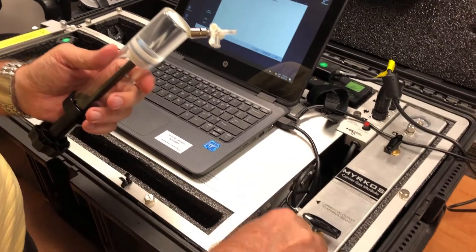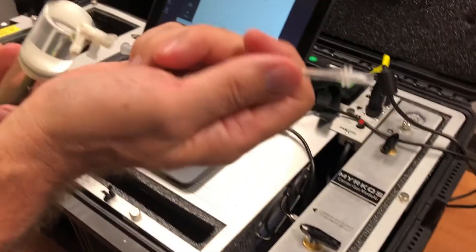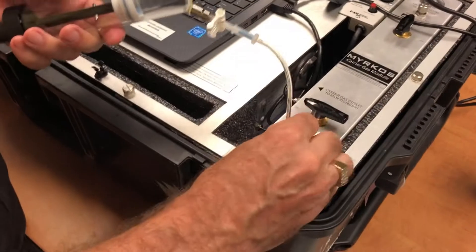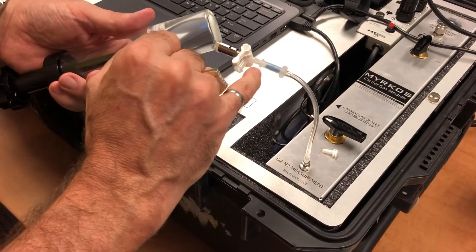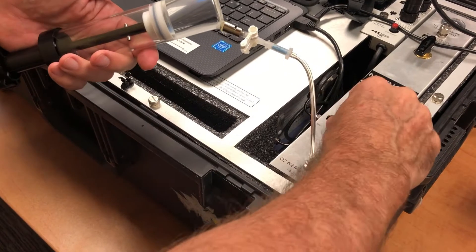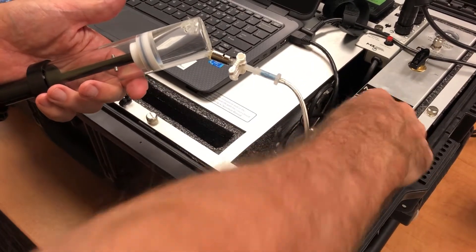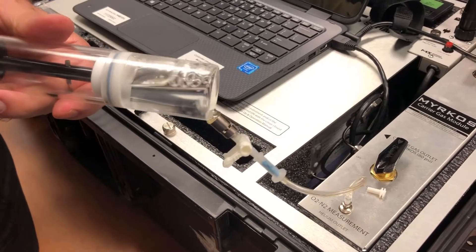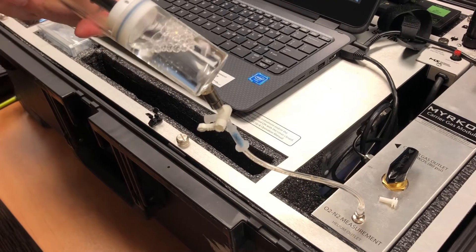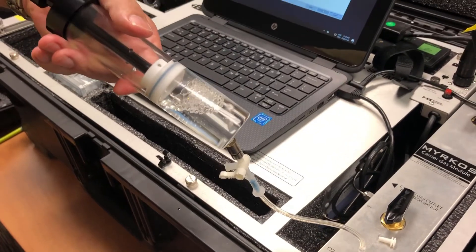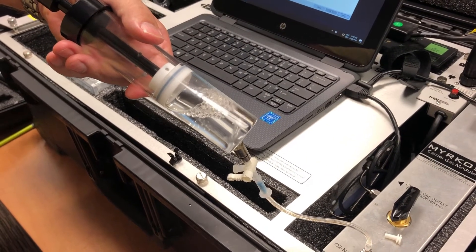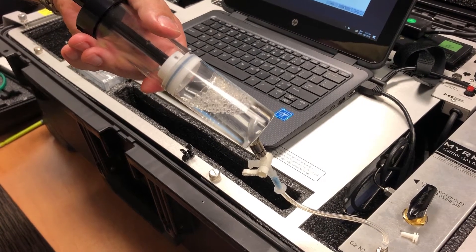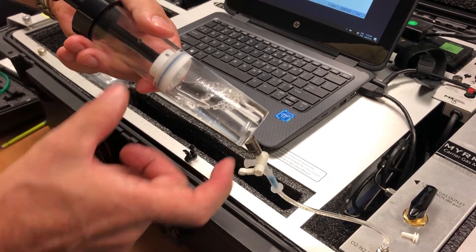So again, what we do here, we remove the pin. You can use one oil trap, and you make sure that the valves here are open, and you fill it up with helium. So we're going to create a big headspace of helium.